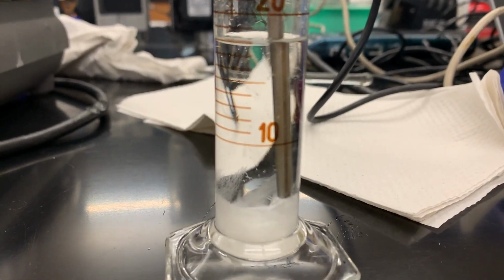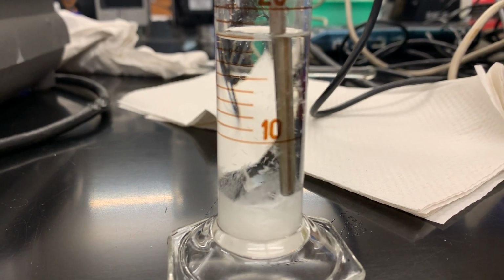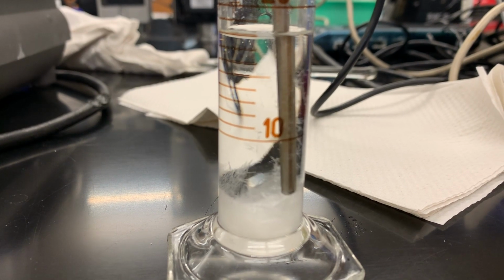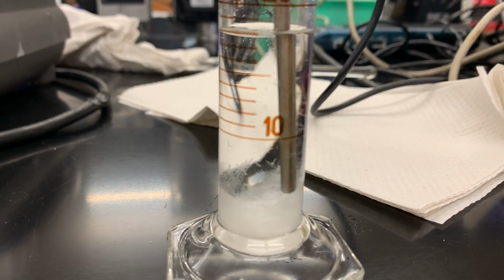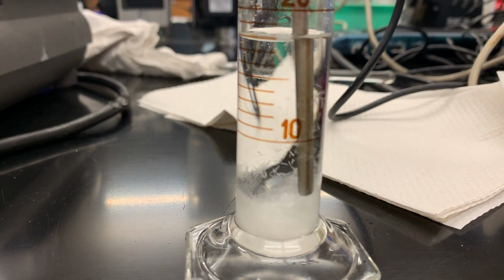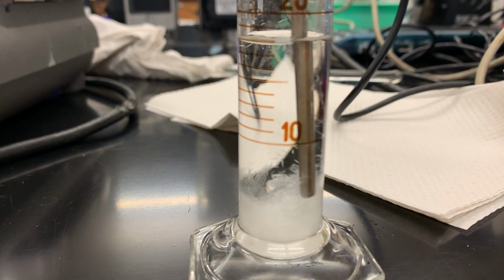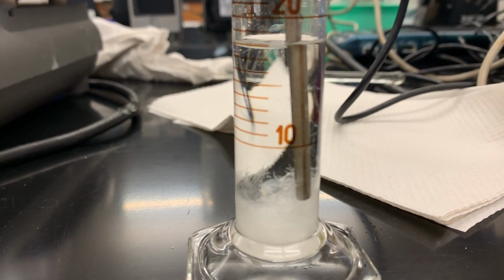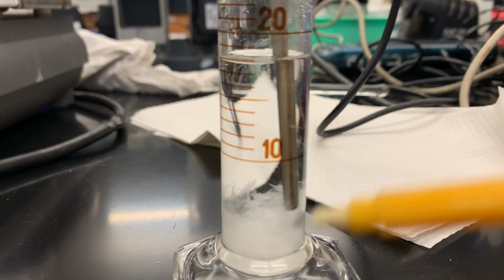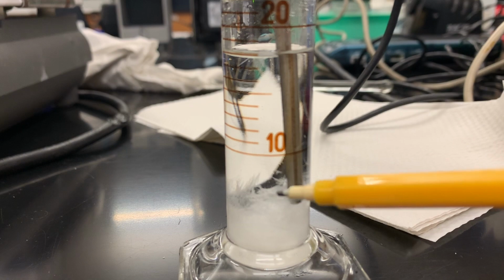So actually I've been letting this sit for a while, and now you can really see the crystals forming, and they're going to the bottom. It's really pretty. So we don't want this many crystals when we record the temperature. That's why I needed to do it right when the crystals started to form, but it looks really pretty, these potassium nitrate crystals falling out like it's snowing. And then on the bottom, they form long crystals here. You can see it.